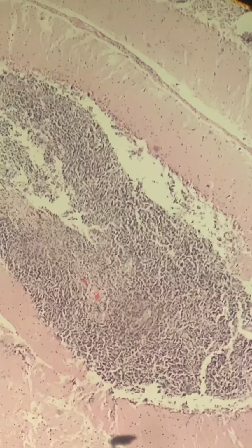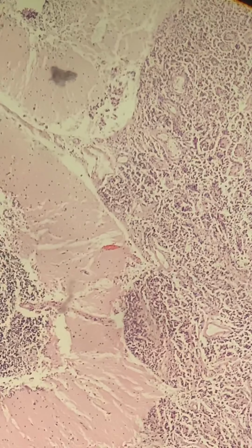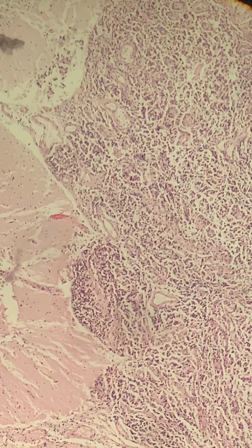This is just relatively intact cerebellum here. The patient had several rounds of radiation, 35 I think it was. He was initially diagnosed about 3 years ago, and succumbed to the illness ultimately.